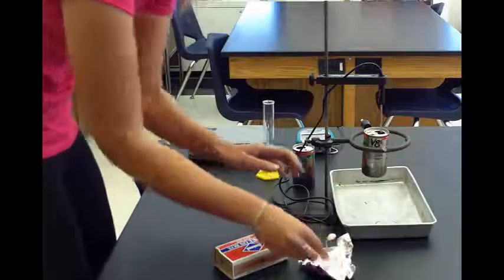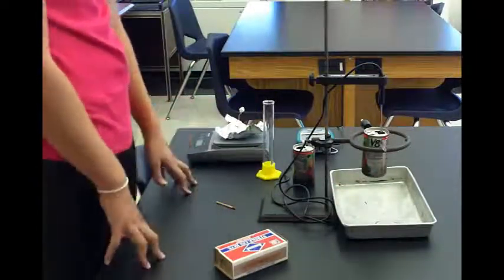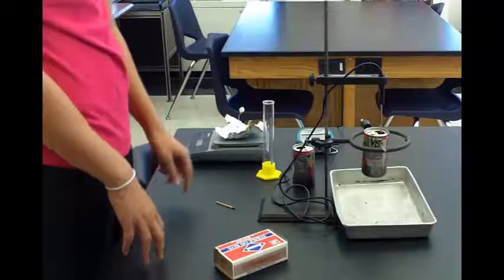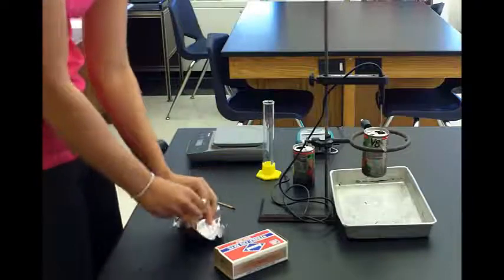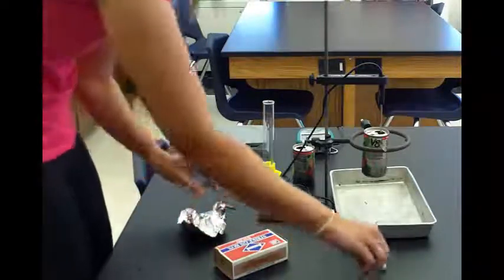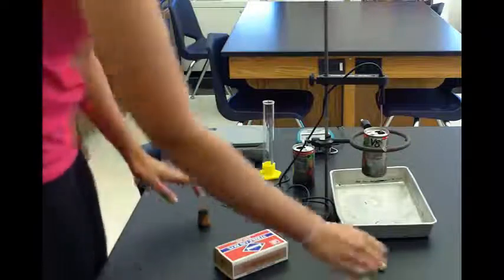Record the mass of the food with the holder, then clean up for the second test. You need to make a whole new holder—new paper clip, new food, and new foil. That can all be thrown away, and then repeat it.